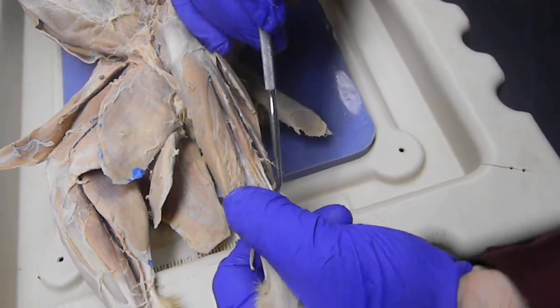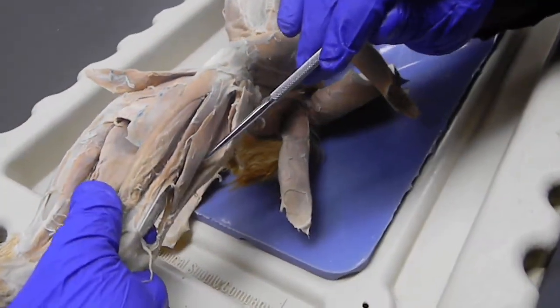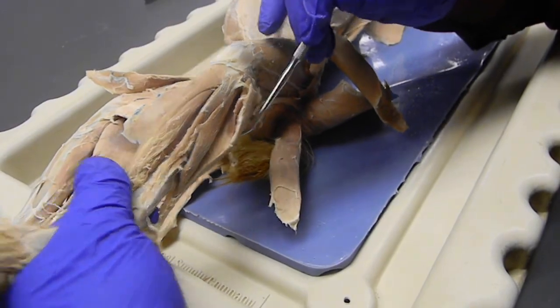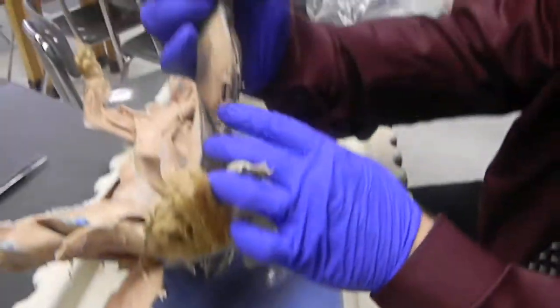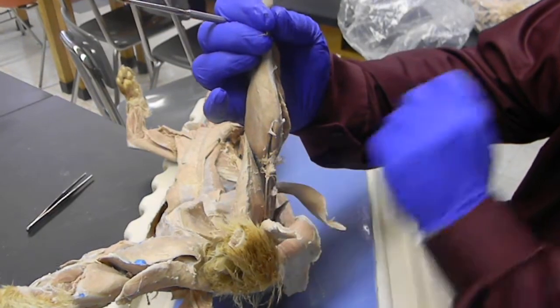We have the Achilles tendon. We have the soleus nearest to the bone that's attached to the Achilles tendon. Then we have the gastrocnemius. This would be the lateral head, and that would be the medial head. Sitting in the center of the gastrocnemius, which probably do it this way the best. So there's our two heads of the gastrocnemius. The one in the center is the plantaris.